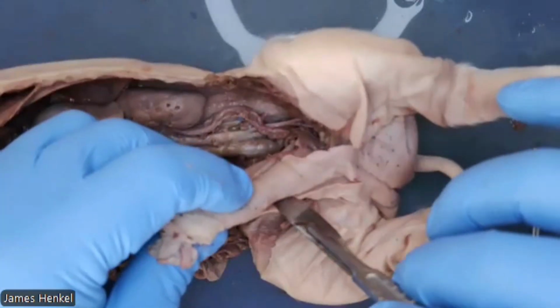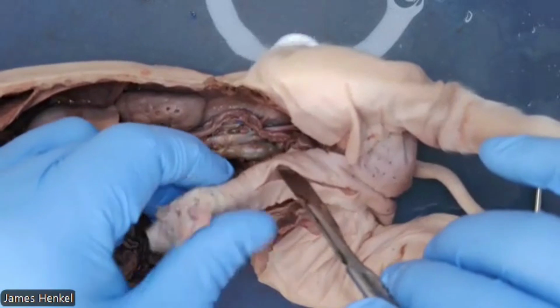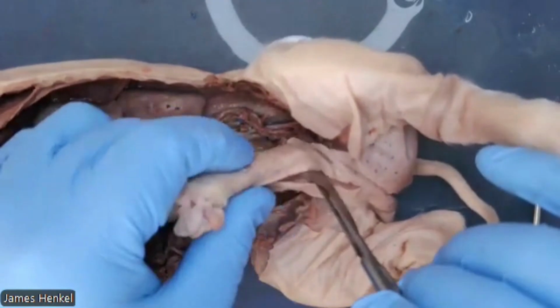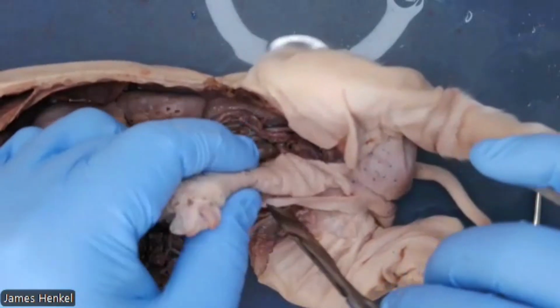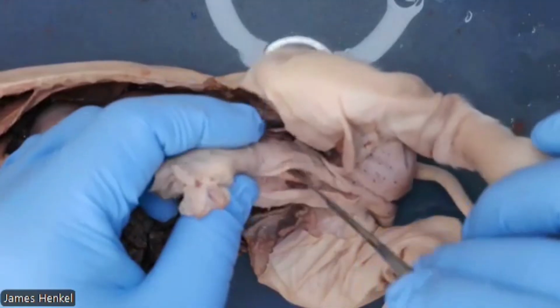And right beneath the surface, sometimes you can see it through the skin, and depending on the pigmentation, is that tube. And I'm going parallel with the skin here just to show it underneath the surface, but do not cut deep. Go parallel with it so you're not cutting this tube.